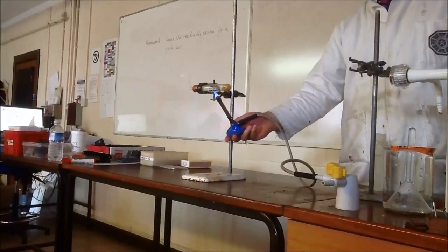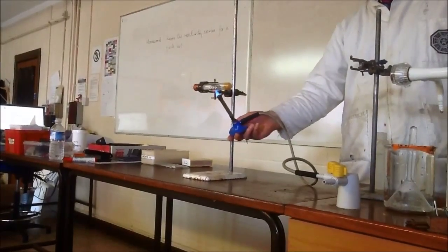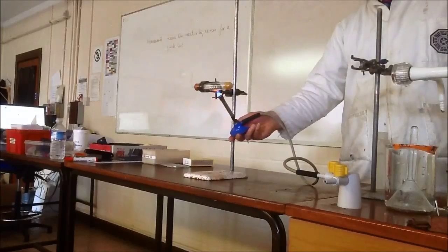So first things first, you have to get the magnesium hot. That requires me heating this directly underneath to make sure it is nice and light.